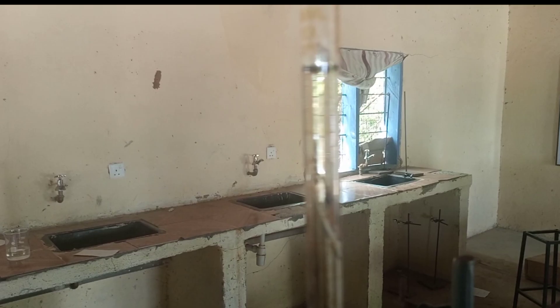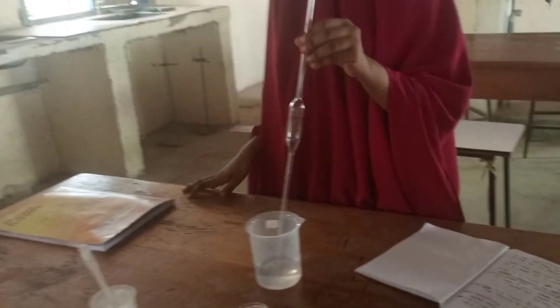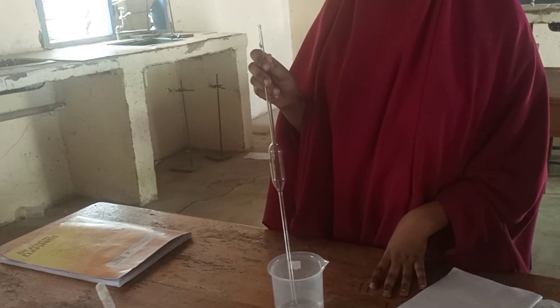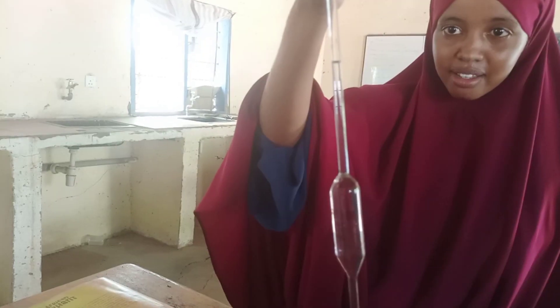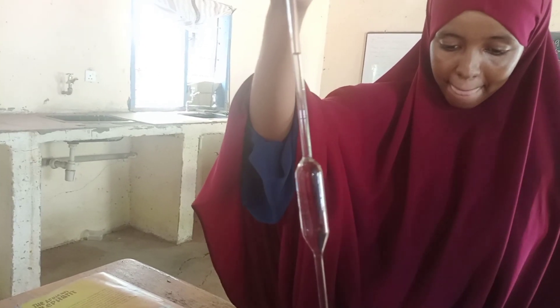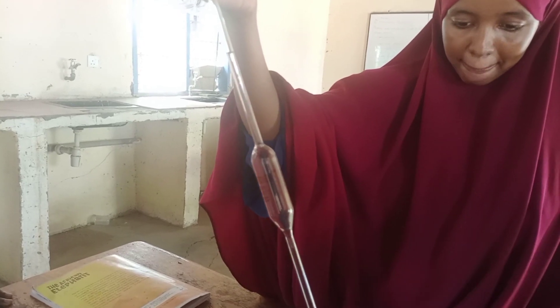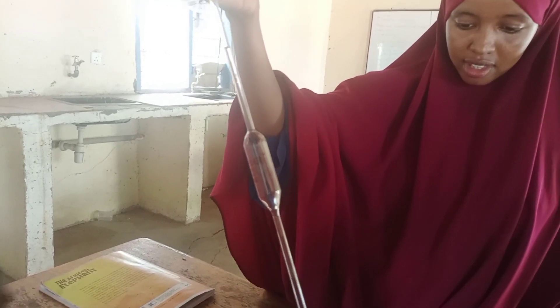The second procedure: we pipette solution G. You can use your mouth when the solution is not toxic, but if the solution is toxic you have to use a pipette filler. You pipette just above the meniscus and then adjust so that it is now at the meniscus — that now means it is 25 ml of solution G. We transfer that solution into a clean conical flask.